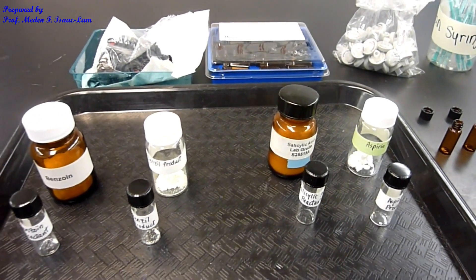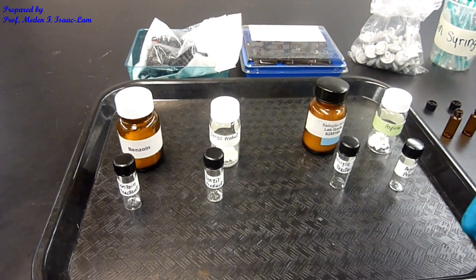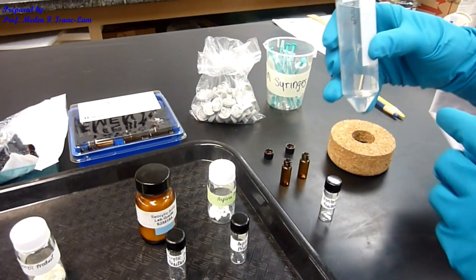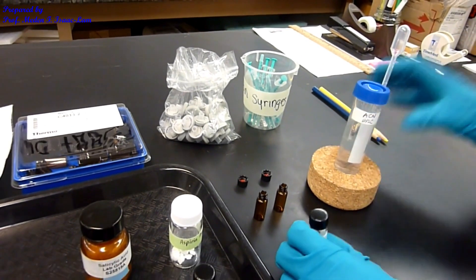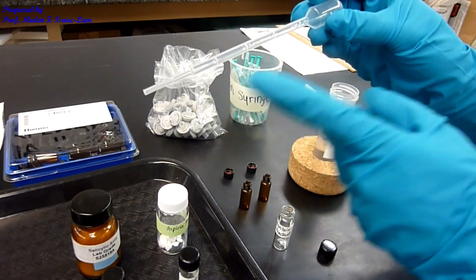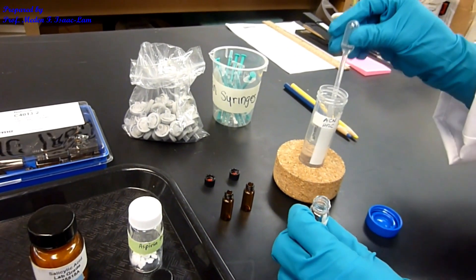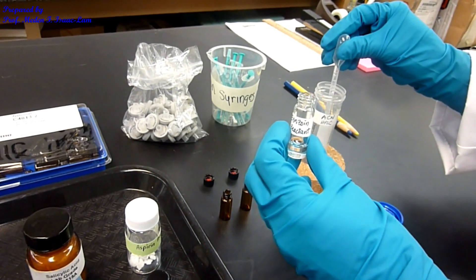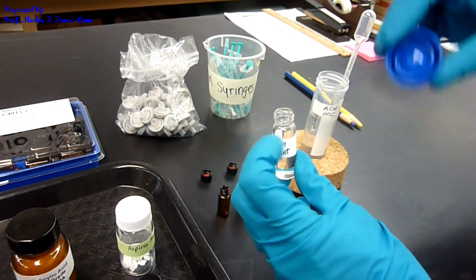After weighing 2 milligrams each of the sample, I will illustrate how to dissolve the sample so that we can do the injection in the HPLC. For example, the benzoin reactant — we are now going to dissolve that in HPLC-grade acetonitrile, 2 mL of the acetonitrile HPLC-grade solvent. I'm using a calibrated pipette, this is 1 mL, so I'm going to use 2 of this. So I'm making 1 milligram per mL of solution to inject into the HPLC — 2 milligrams per 2 mL, or 1 milligram per mL.